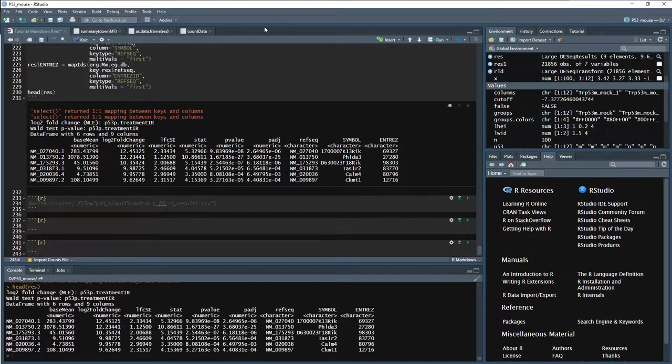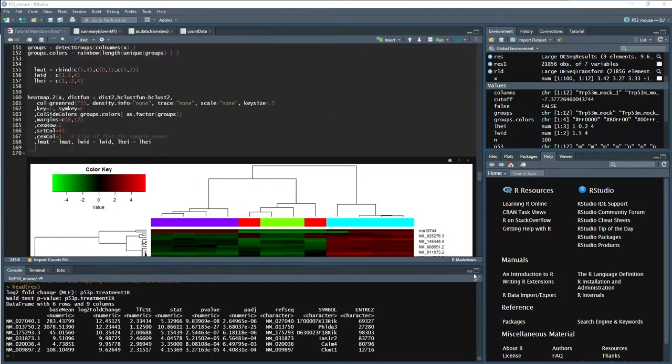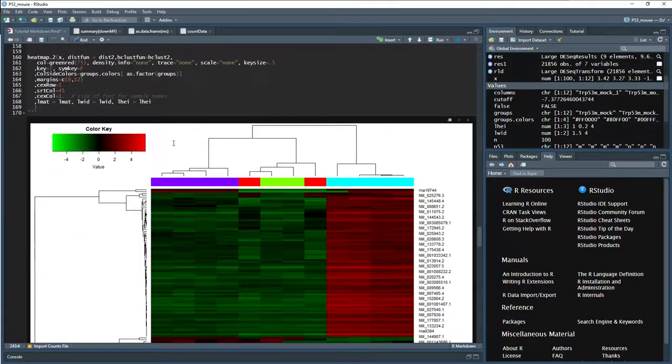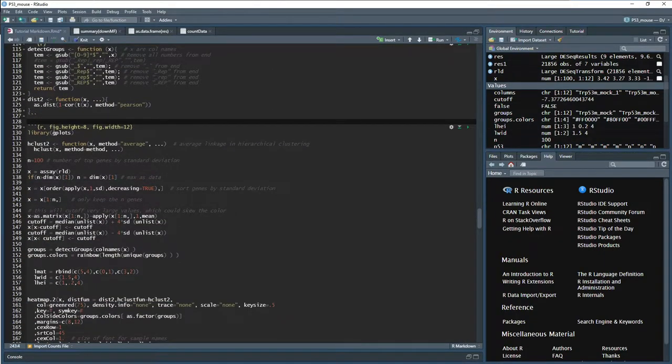All right, everybody. So today we're going to kick back off and we're going to do some Go enrichment. Before we get into it though, last time we had an error that had shown up for our heat map. And that error was something like plot.new, plot margins are too large or something like that.